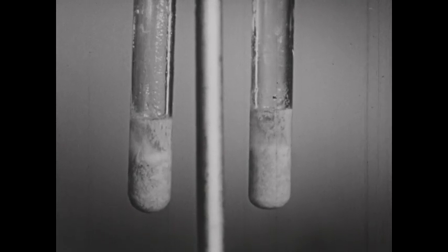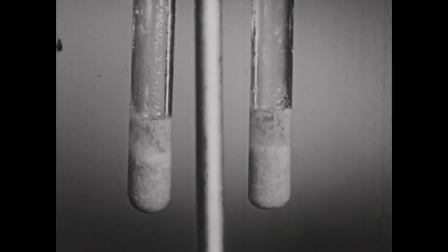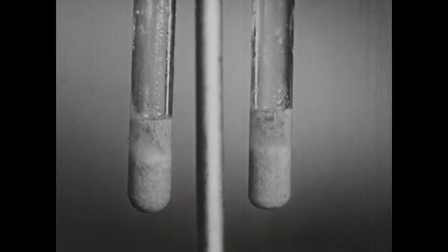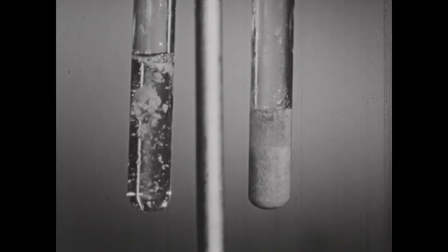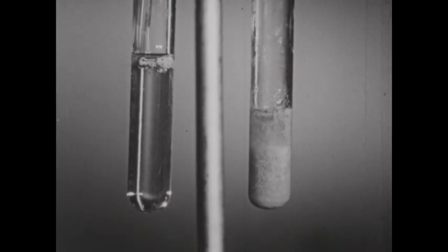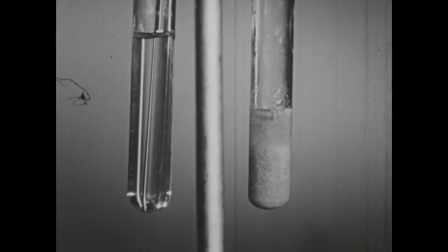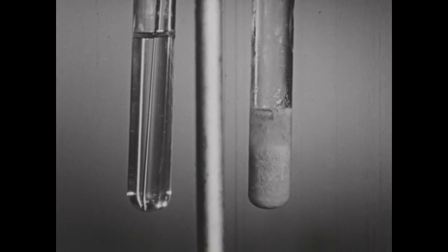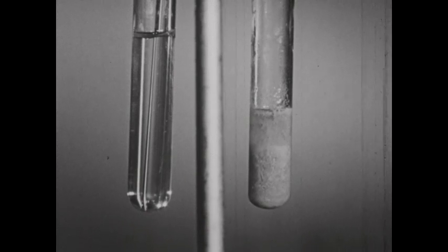We've seen before that we can dissolve a precipitate if we cause the product of the concentrations of its ions, raised to the appropriate power, to fall below the solubility product constant. In the case of silver phosphate, we can lower the concentration of either the phosphate ion or the silver ion. To the tube on the left, dilute nitric acid is added, and you can see that this precipitate rapidly dissolves. The dilute nitric acid reacts with the phosphate ion, converting it to phosphoric acid, reducing the concentration of the phosphate ion so that the solubility product conditions are not met.